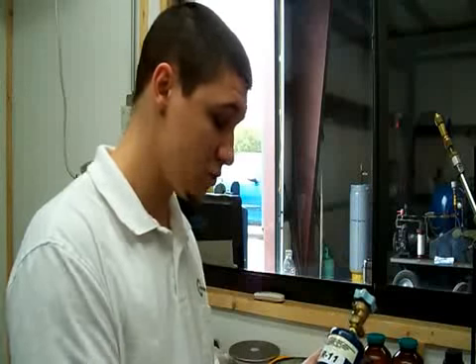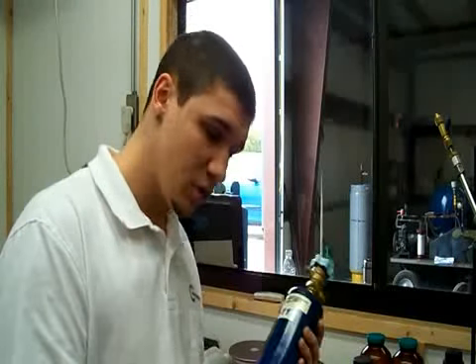We have a batch number that we put on every cylinder that we send out that shows what batch it came from. This will have a batch number labeled as it comes back from InterTeck, and each cylinder that we send out to any contractor will be placed with that batch number, so we can trace it back to this little blue sample bottle that represents 10 or 20,000 pounds. That's great. All right. Well, thank you, Dylan. Appreciate it very much. Thank you.